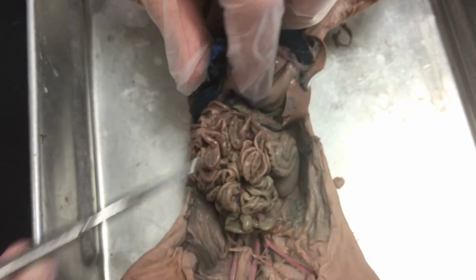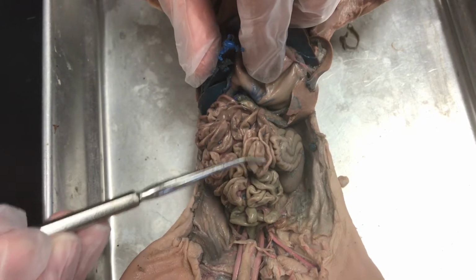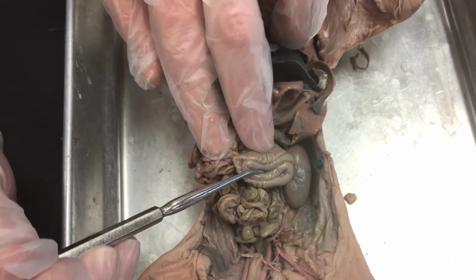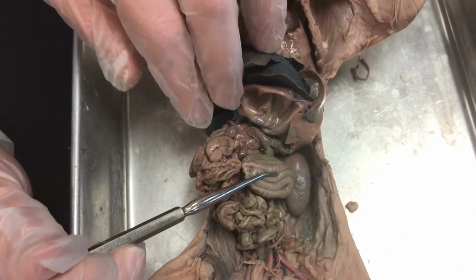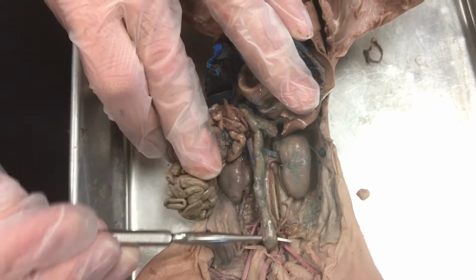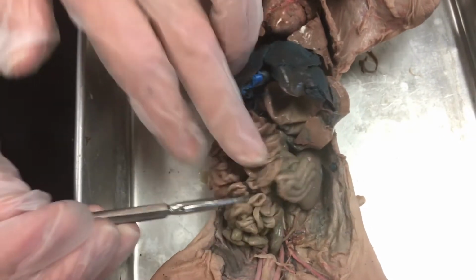The small intestine is this region right here where it's pretty crinkly, and I guess we'll stick with crinkly. This is the small intestine. And then here, where it's just a little bit smoother in appearance and not quite as wavy, this is the large intestine. And then that large intestine eventually turns into the rectum, which is going to carry waste out of the body. So then we'll kind of move back to the top part of the pig.